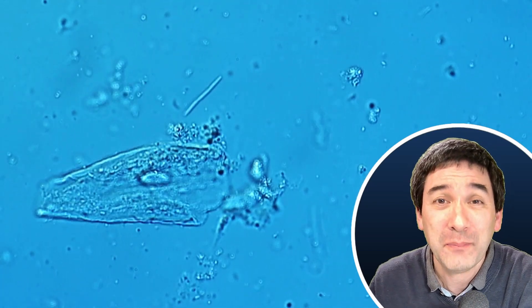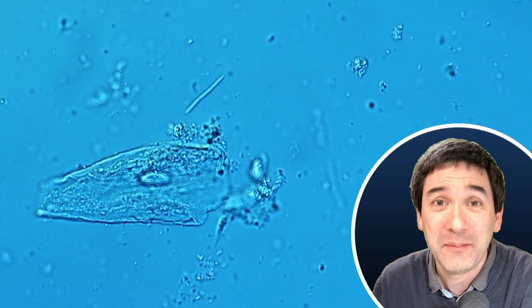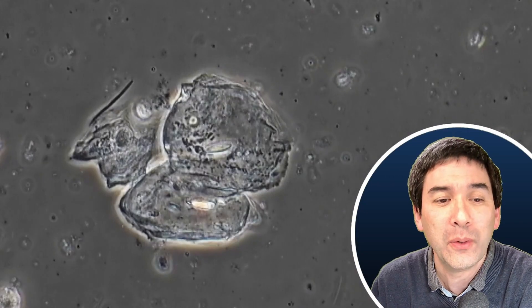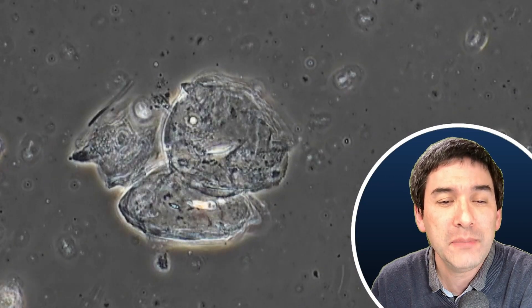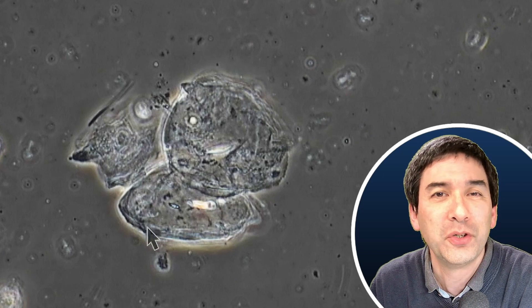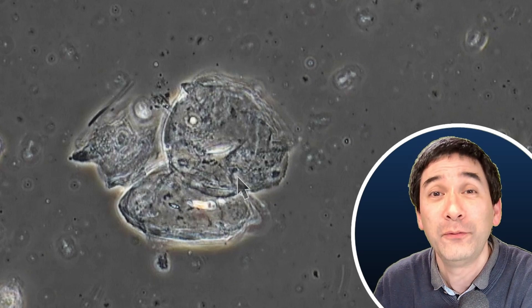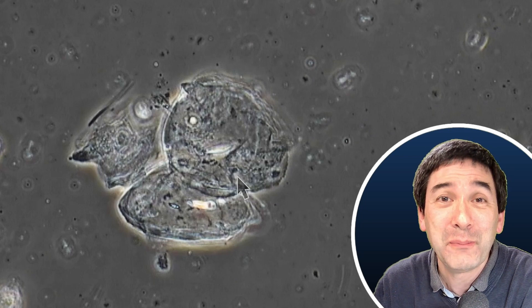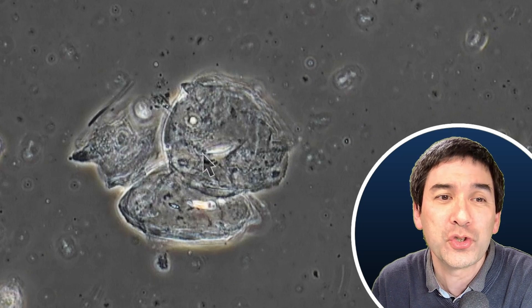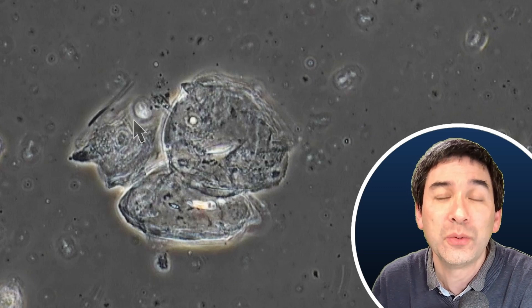Phase contrast is especially important for seeing bacteria, because yes, there are many of them in my mouth. I'm going to activate my little arrow and pause the video to show you a few things. Those structures here — what could they be? Well, these are the cells of the inside of my mouth: epithelial cells. They came off and found their way onto the microscope slide. You can see that each one of those cells has a little oval or round structure on the inside — that is the nucleus, where the DNA can be found. In this case, you've got around three cells here still sticking together.